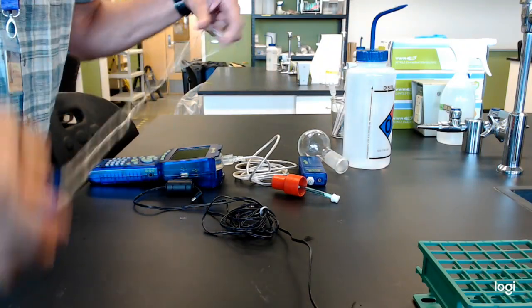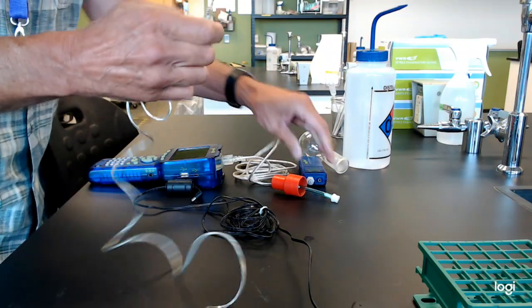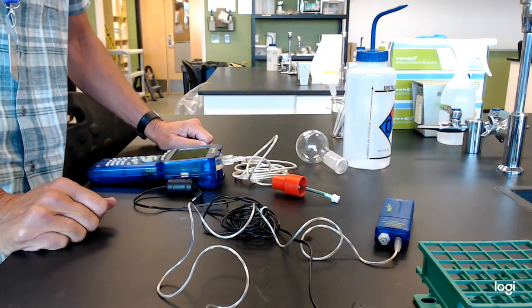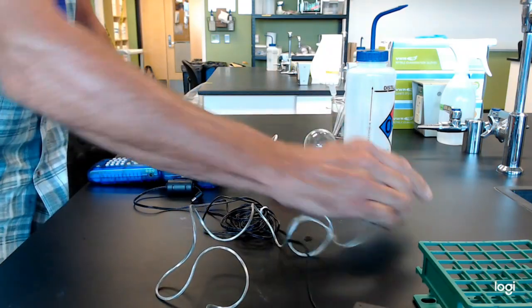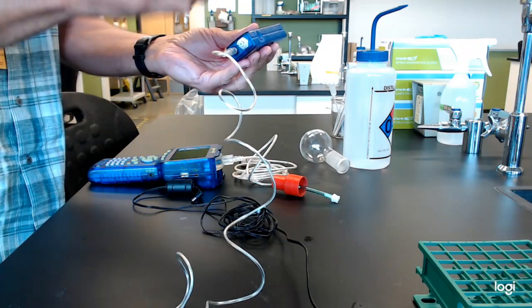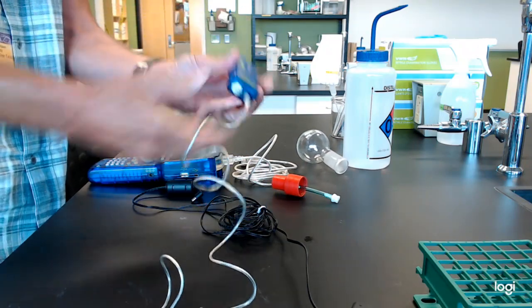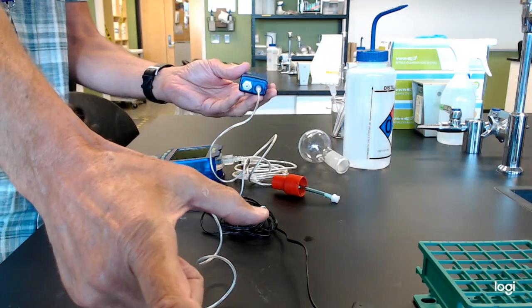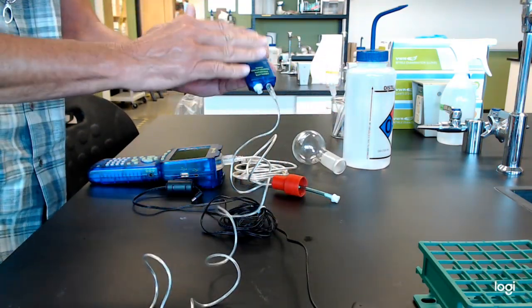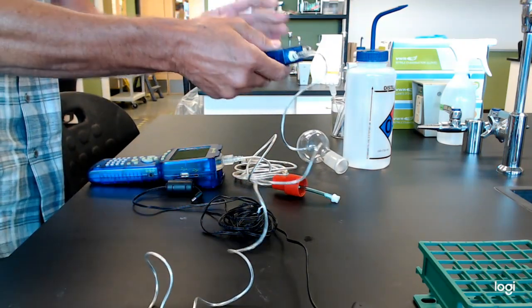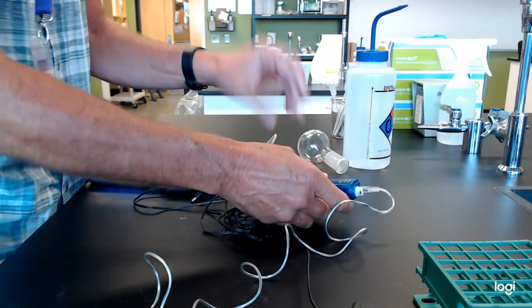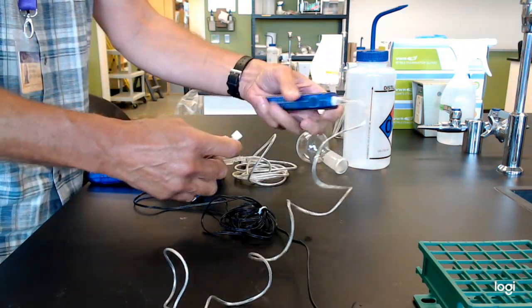If you have a sensor, like this pressure sensor piece here, they usually have a blue box that they work through. You need a blue box because it's what actually has the software that commands the data logger and says, oh, we're doing temperature. So it changes the voltage and current into something you can use as far as reading temperature.